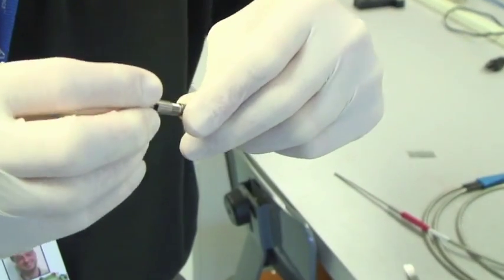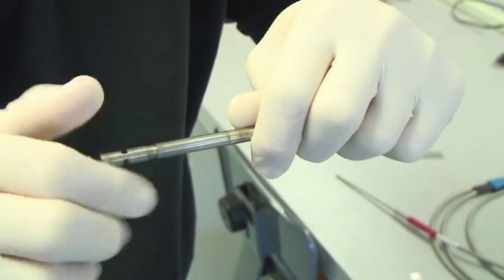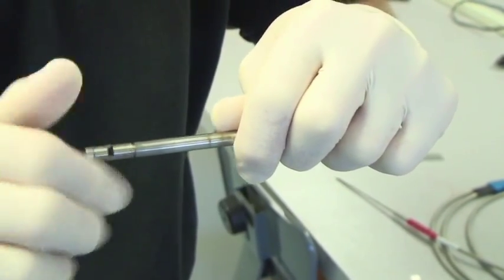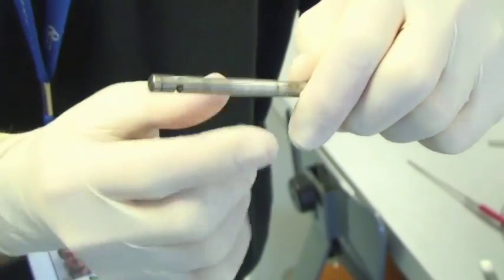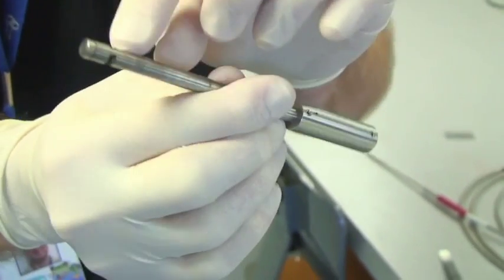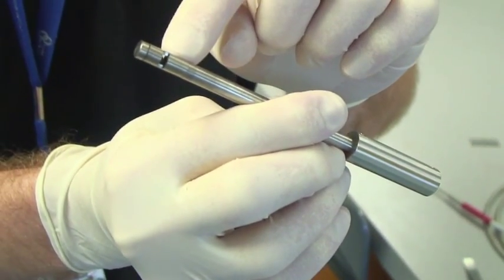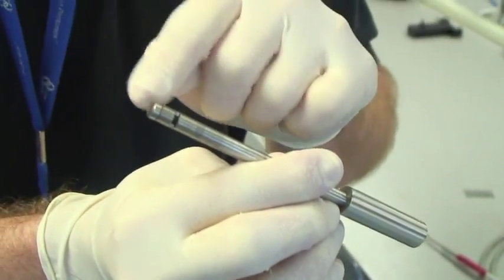Now with the patch on, we can take the cap and just screw it back on all the way. Make sure it's on tight. So the main ferrule is ready now. We have the patch installed - the pH patch here at the tip - and the mirrors here.